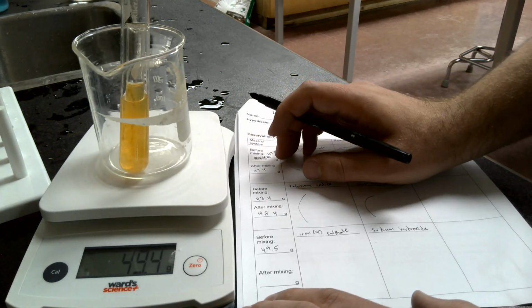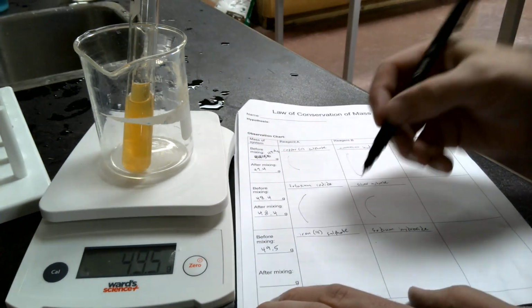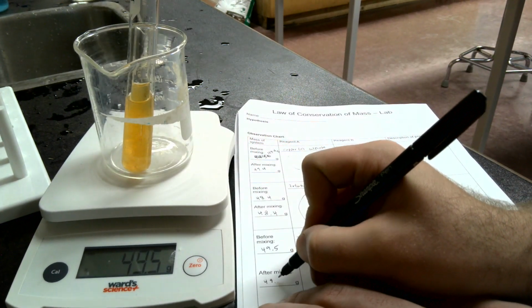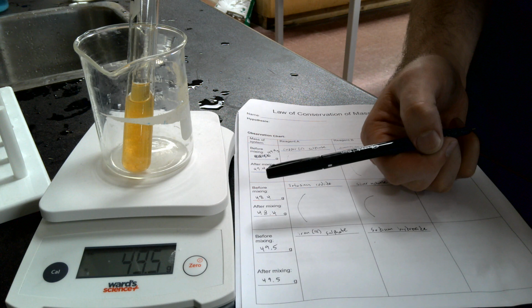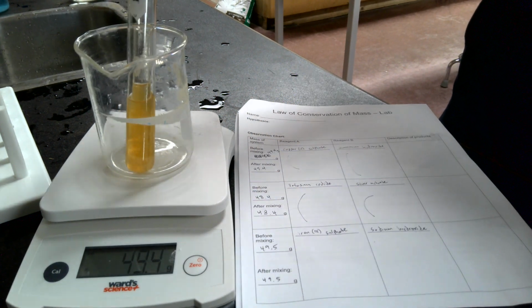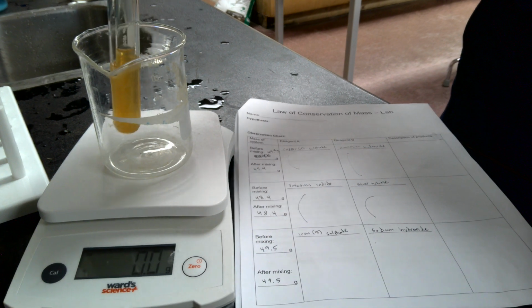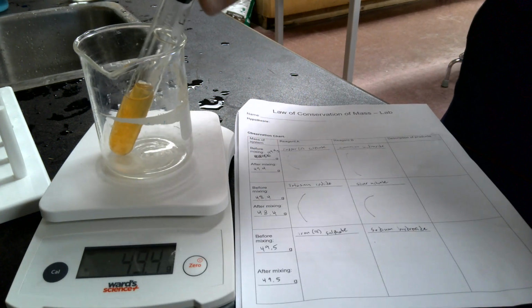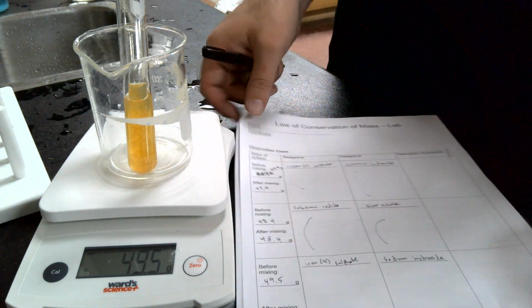So you still have 49.5. Sometimes if you're really close to the in-between, so this is actually probably pretty close to like 49.45, that is the time when it will start switching back and forth. So you might have noticed this at 49.4 the first time I did it, like there, 49.4. That will have to do mostly with small error in the scale, or being really close to the in-between weight. But 49.5, we had it there. Right there, 49.5. So there is some error in these scales to be expected.